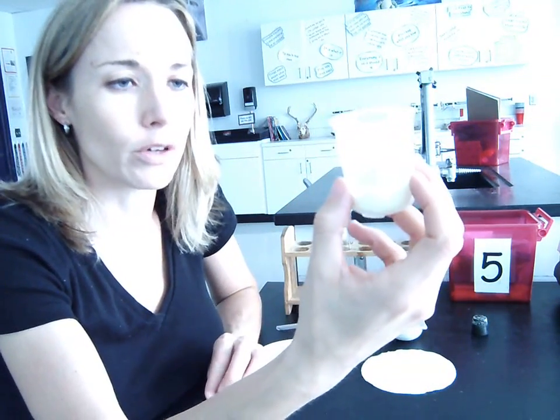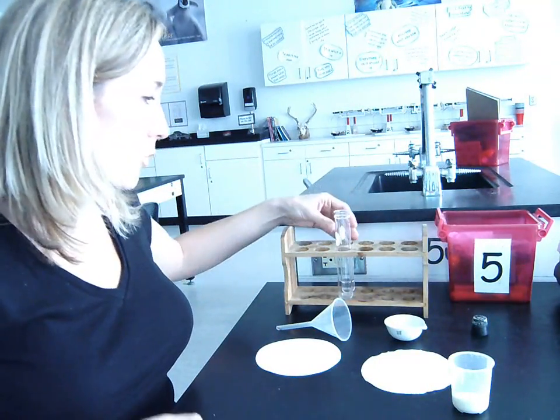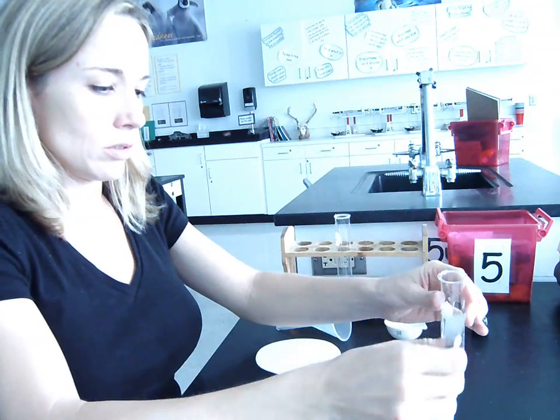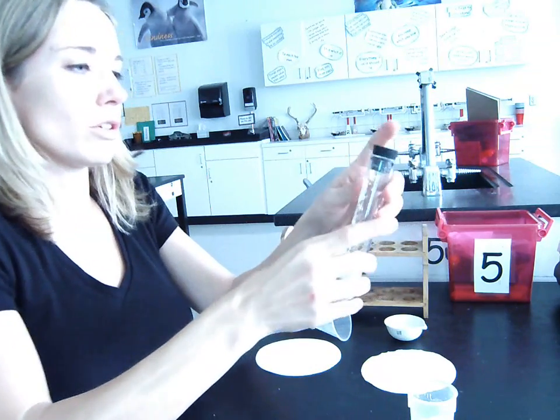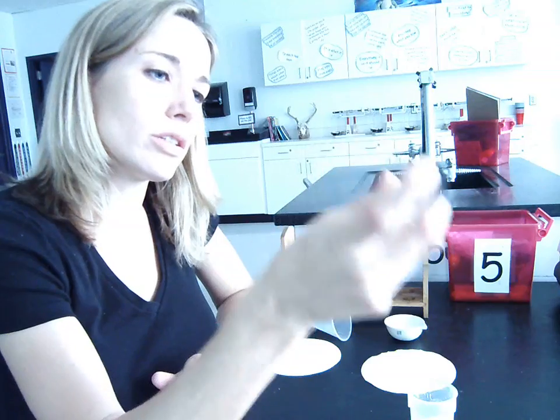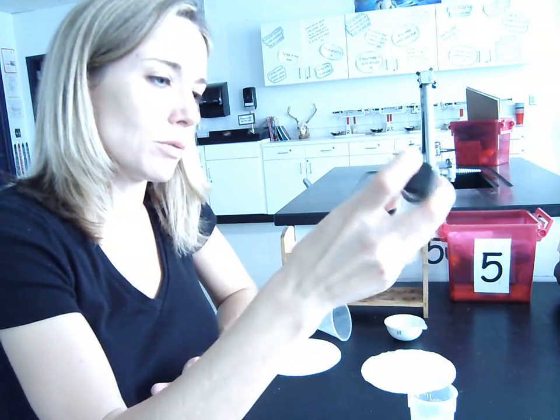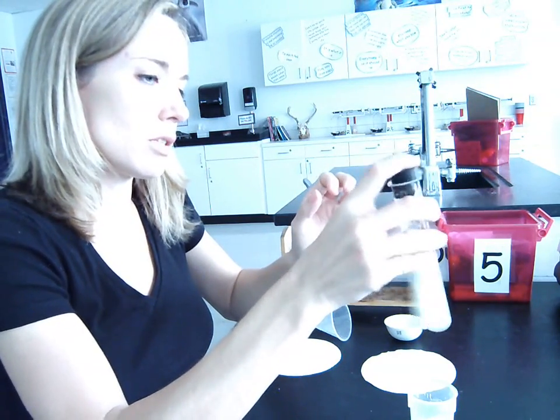So that's 5.4. So here's what we do with 5.4 in order to separate the two substances. So we have salt and we have sulfur, and then we want to be able to separate them. Now, because one of them dissolves in water, what we do is we take a sample of our mixture and we add it to the water. And then we use the characteristic property of solubility to allow the salt to dissolve while the sulfur does not dissolve. So we mix it up for a little bit and we allow whatever is going to dissolve to dissolve. Mix it for a few minutes.